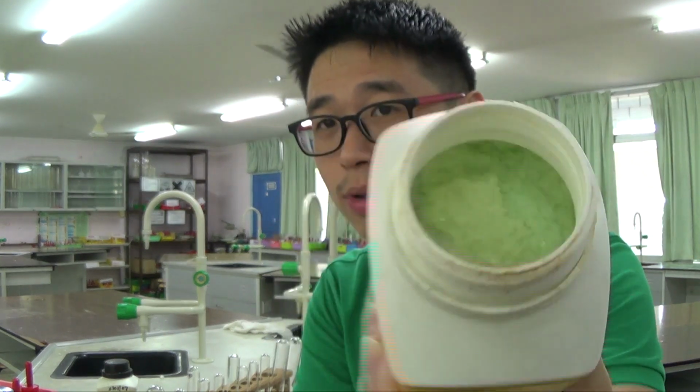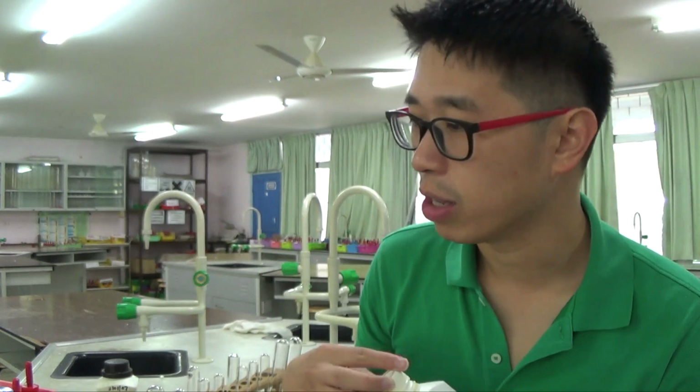Okay, so this is something that we'll analyze as well today as part of our in-depth analysis into the ammonium ion. So of course, what I've talked about is ammonium chloride, ammonium carbonate, as well as ferrous ammonium sulfate. So we have different anions, the first one being chloride, the second one being carbonate, the third one being the sulfate, in their respective order. So I'm more interested in the cations in this particular video tutorial, but I'll have other qualitative analysis videos where I talk in depth about the test for the anions.